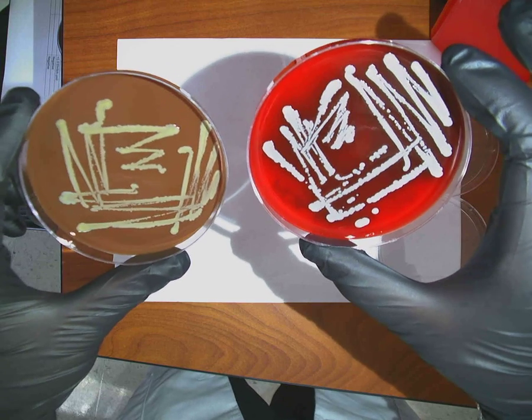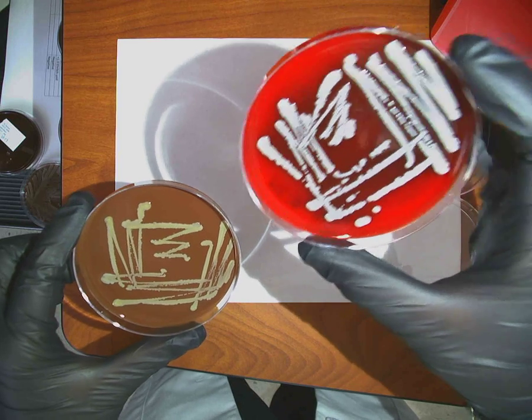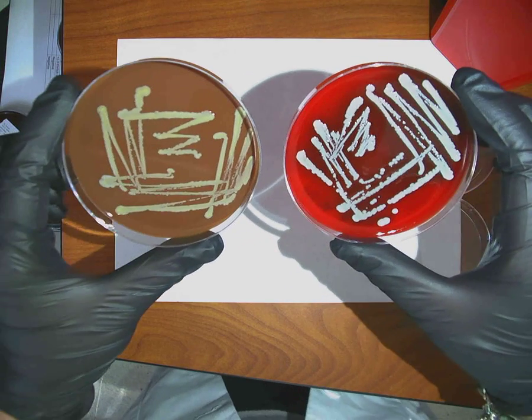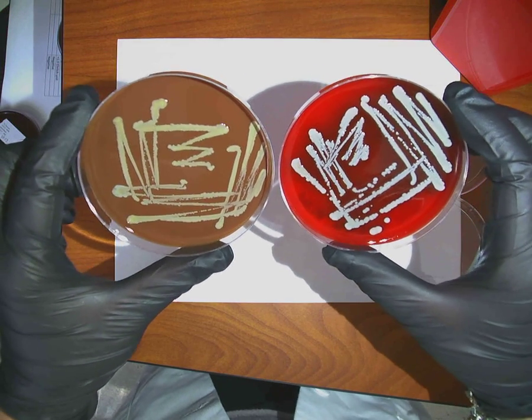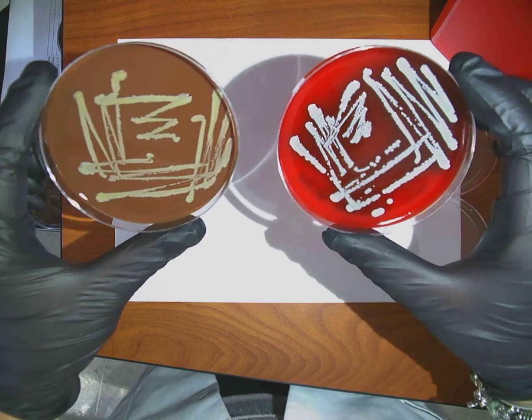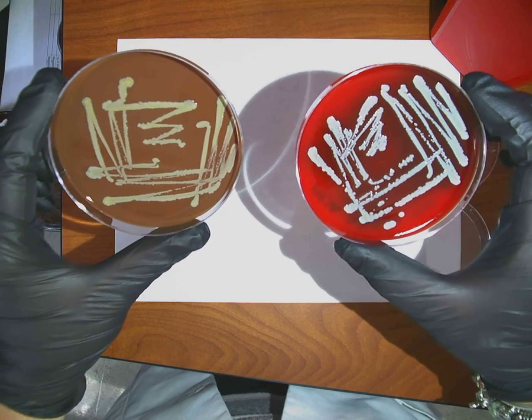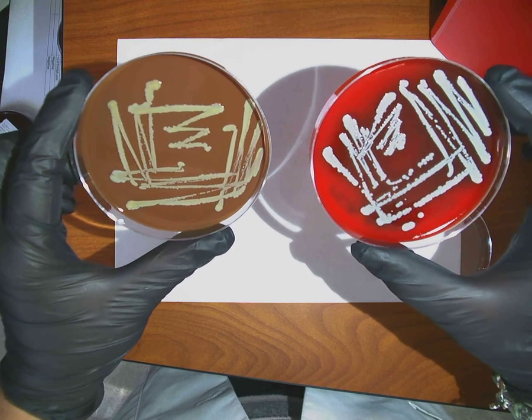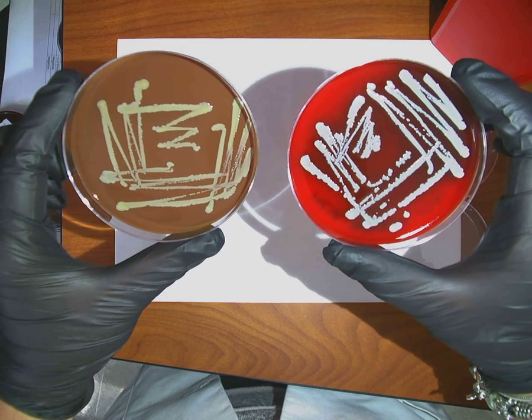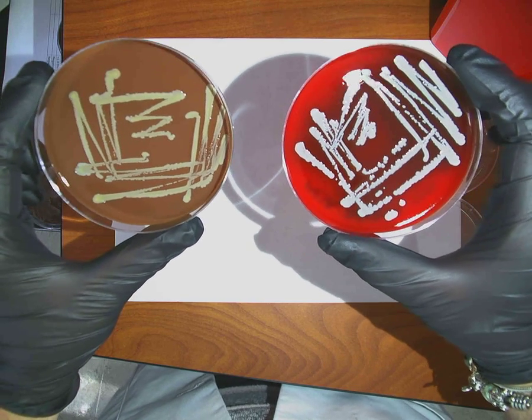Now, the hemolytic pattern on here, it's not beta, it's not alpha. It's really doing something odd and weird, okay? So sometimes you have to think outside the box whenever you're looking at hemolytic patterns on colonies that are bright, white, and creamy like this, because they can lose their hemolysis, okay? That happens as organisms mutate and their genome changes. So you want to make sure that you don't completely hinge your identification on the hemolytic pattern. But organisms like Streptococcus pyogenes, they're going to have it.